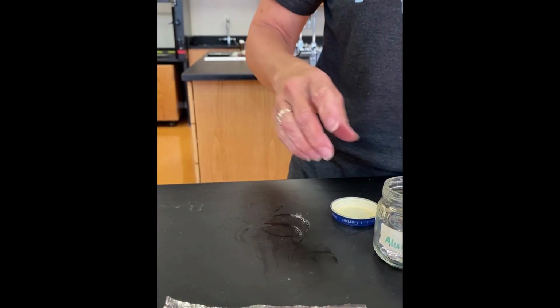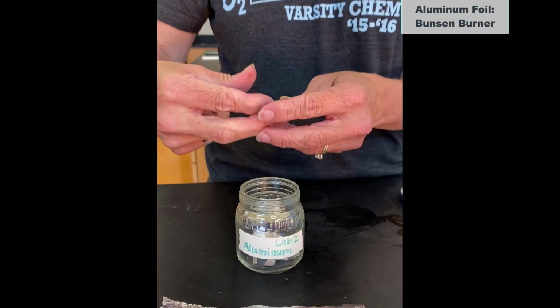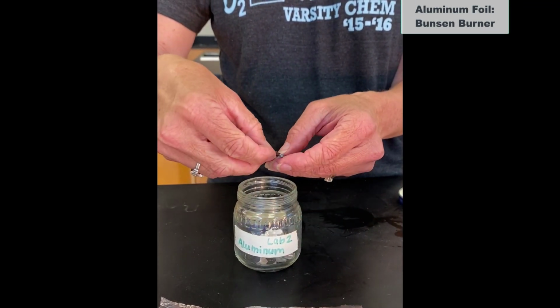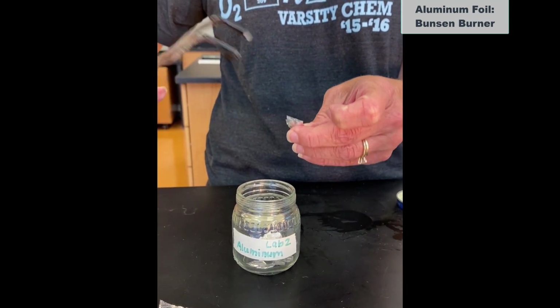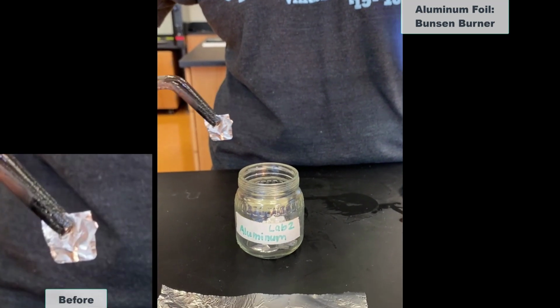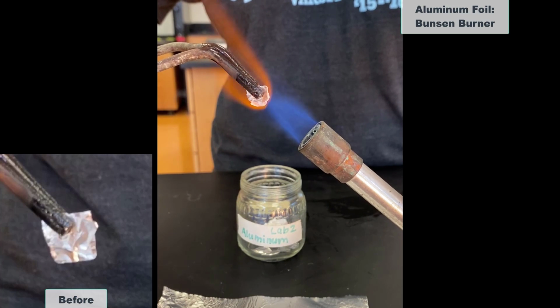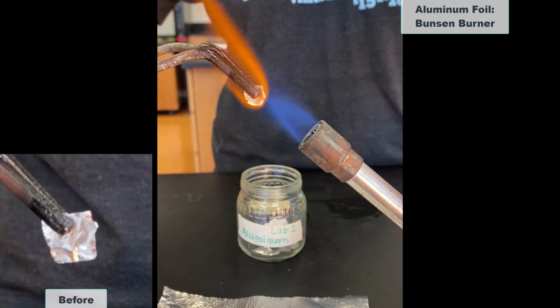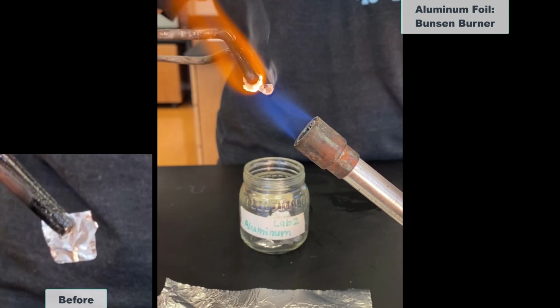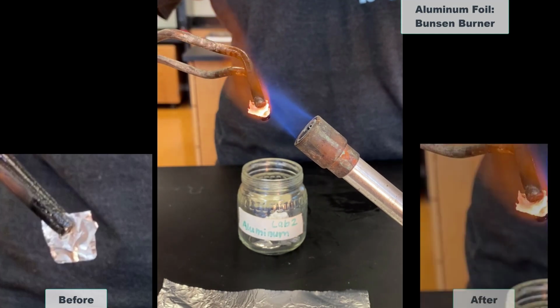And now on to aluminum. Here's my aluminum. And we definitely have changes, but I do still have some aluminum on the end of my tongs.